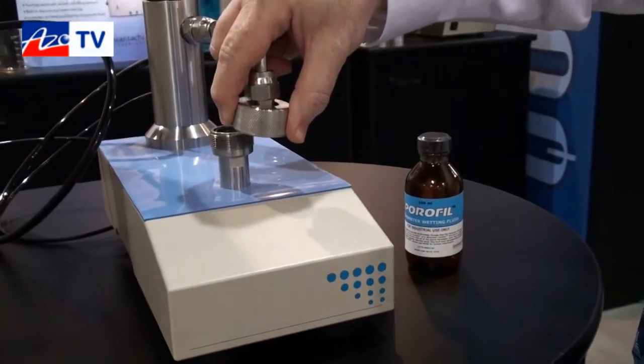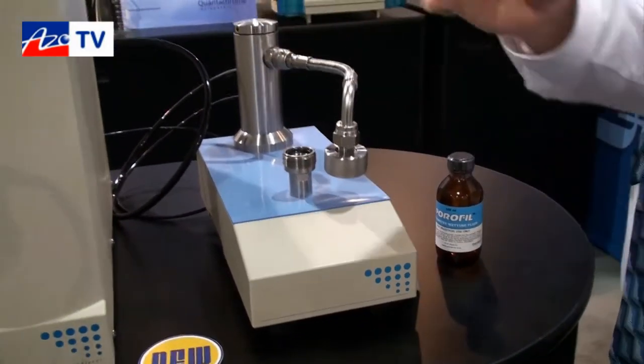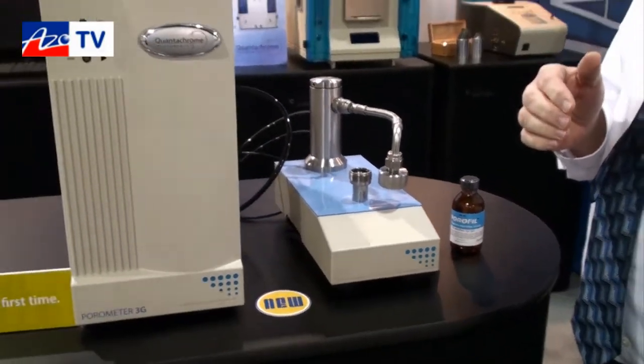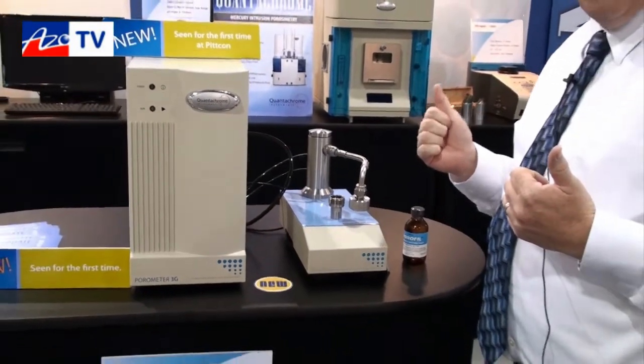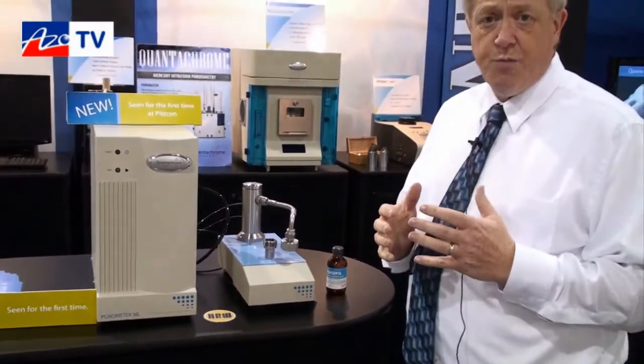Once the sample has been wetted, the operator just has to screw the sample holder down. Then in the software, the only parameters the operator has to set are the starting pressure and the total finishing pressure. The starting pressure, the lowest pressure, determines the largest pore that's going to be measured. The highest pressure, the ending pressure, determines the smallest pore that's going to be measured.